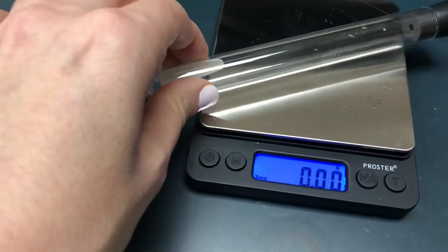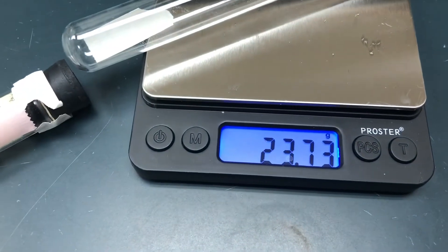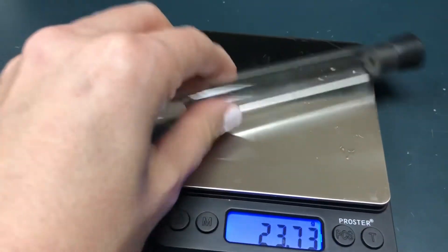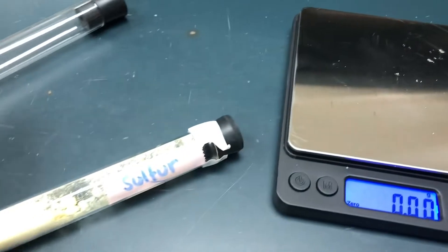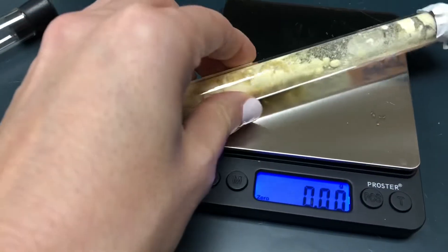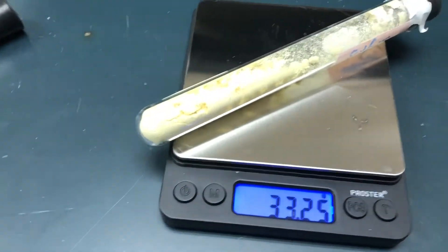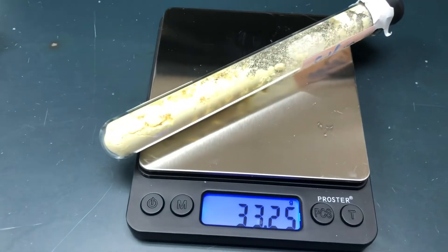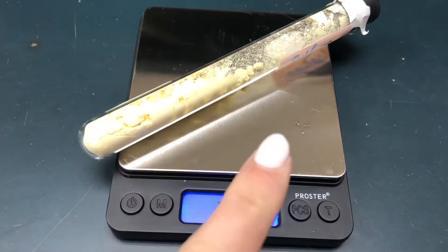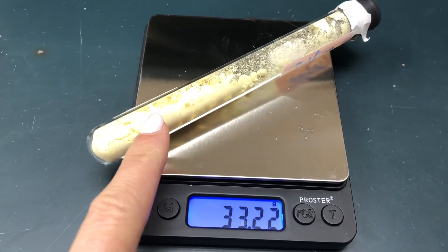Now I'm going to weigh the sample that also has the test tube and the stopper with it. Think about what you need to do to just get the mass of just the sulfur, not the test tube and the stopper with it.